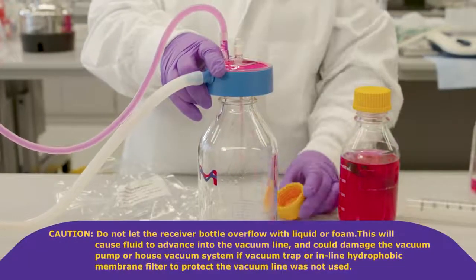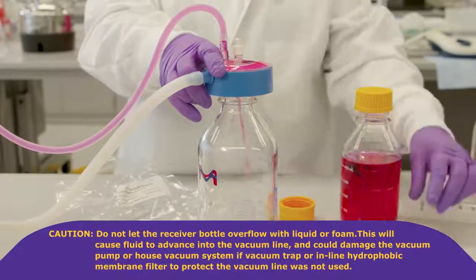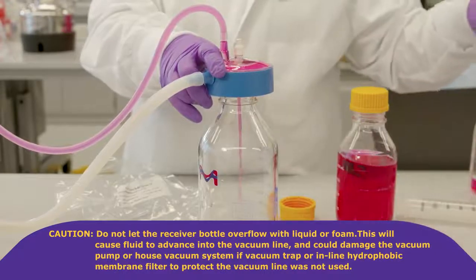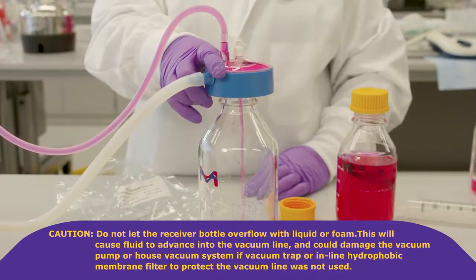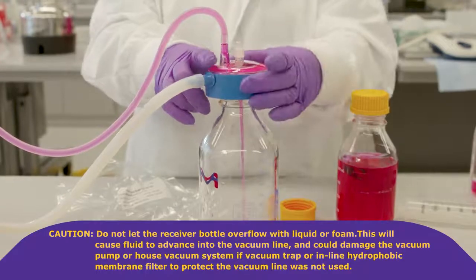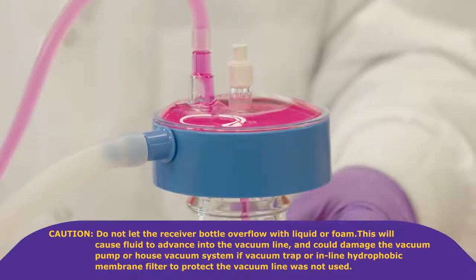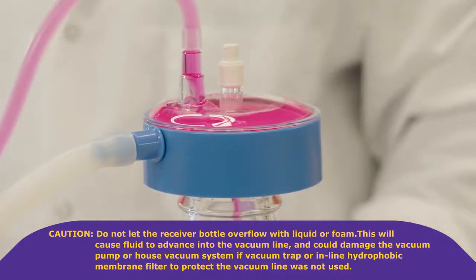Caution, do not let the receiver bottle overflow with liquid or foam. This will cause fluid to advance into the vacuum line and could damage the vacuum pump or house vacuum system if vacuum trap or in-line hydrophobic membrane filter to protect the vacuum line was not used.